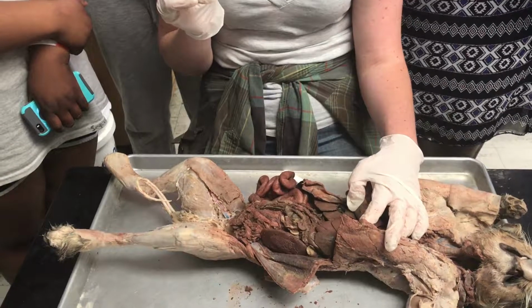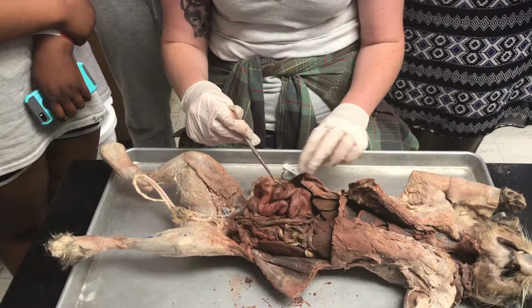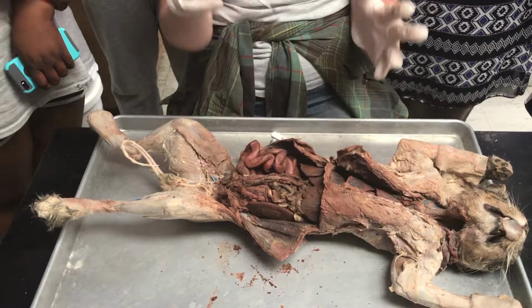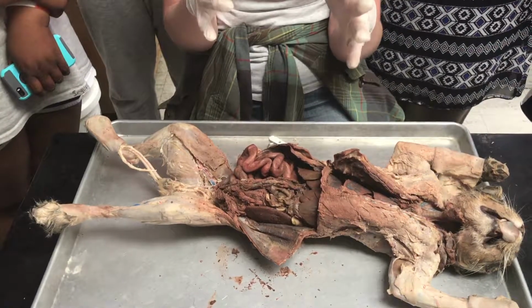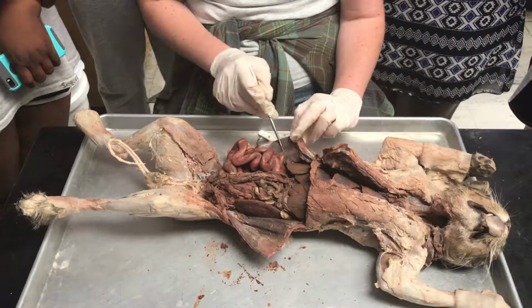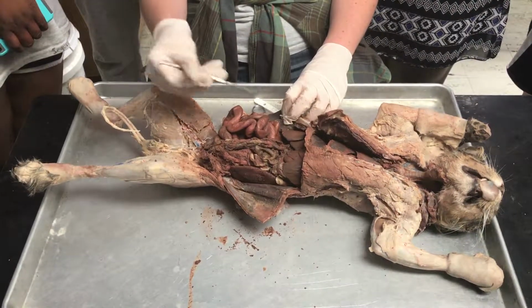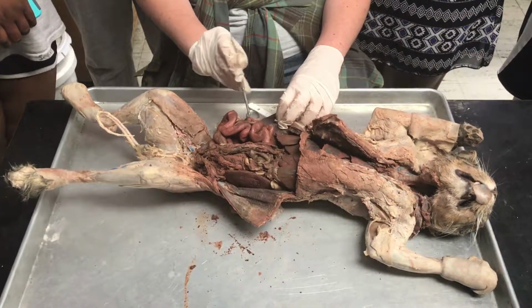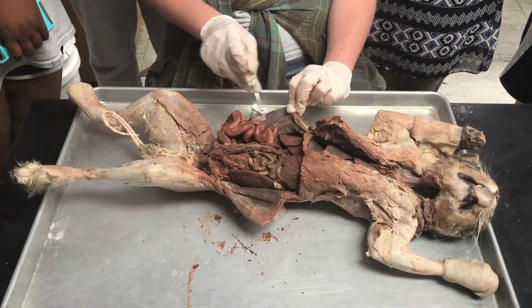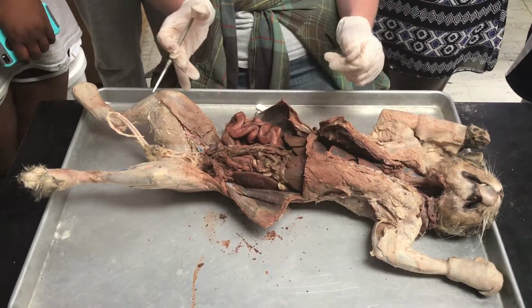So last is the cavity itself. The abdominal cavity itself is called the peritoneum. You have 2 layers in the abdominal cavity, and they line the organs and they line the cavity itself, and it's called the peritoneum. So you have 2 parts: the visceral peritoneum, which lines the organs themselves. This is a shiny layer over it, and that's part of the peritoneum. And then this part on the wall is called the parietal peritoneum, and that's going to line the wall.